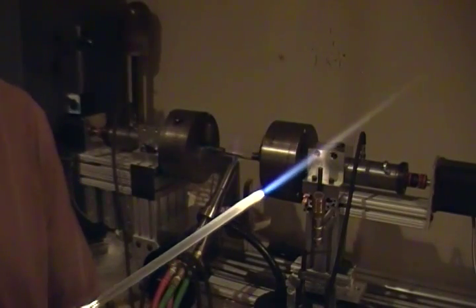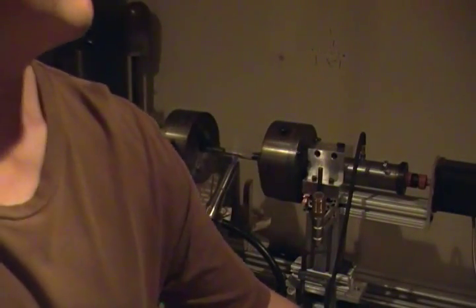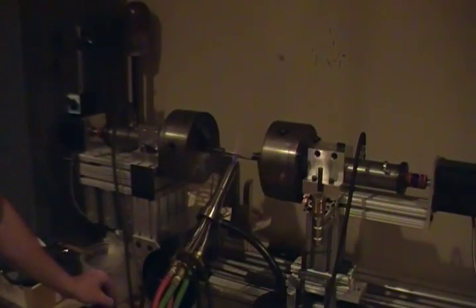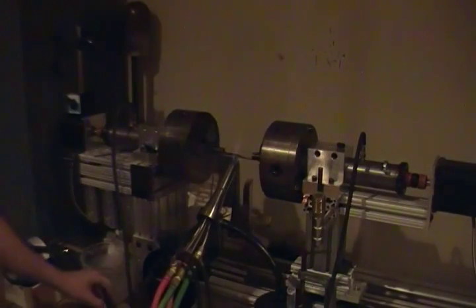Hydrogen's really small atoms. Very light, so they flow really fast and gives you a really interesting flame characteristic as opposed to propane or a heavier hydrocarbon fuel. Anyway, we got the torch on. We're kind of doing a little bit of just soak. Silica has basically almost no appreciable thermal expansion coefficient, so you can really just go right in with the flame, not have to worry about thermal shock.